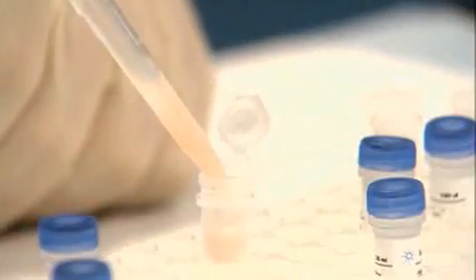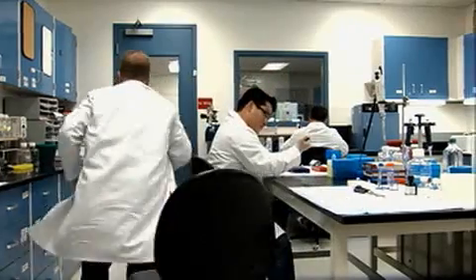Just about off to the centrifuge. Nice clean drop of the homogenate. Did you see that spin move? That's exactly the type of play that makes this guy stand out. Not to mention that fake.